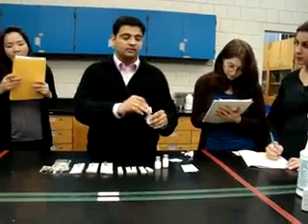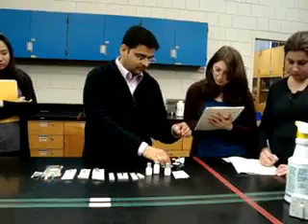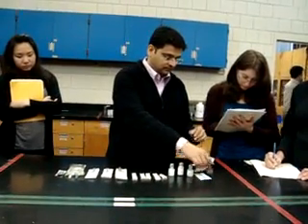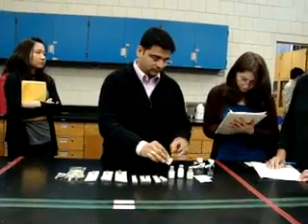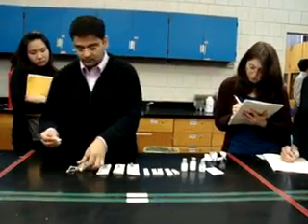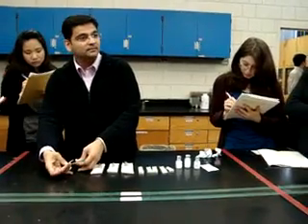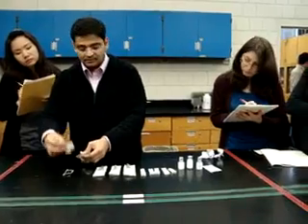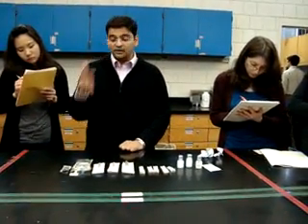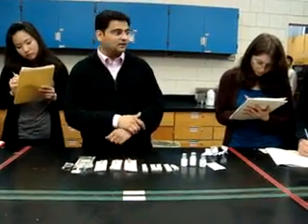You are supposed to clean the top — but please, just once, not like this repeatedly. That is not professional. Also, remember: after you clean the bag, put the alcohol prep down and put the bag forward on top of it. A lot of students forget that, and that is a chance for contamination. Please remember to put the alcohol prep under the bag.